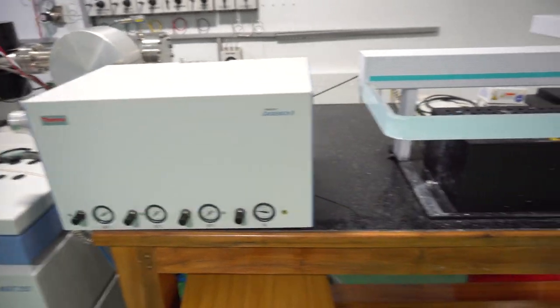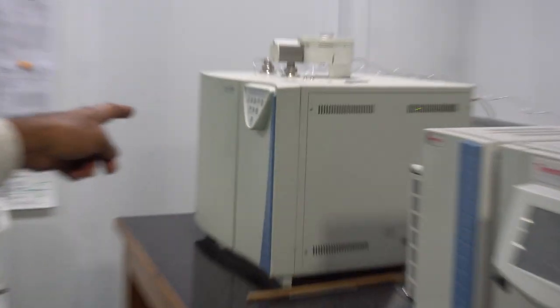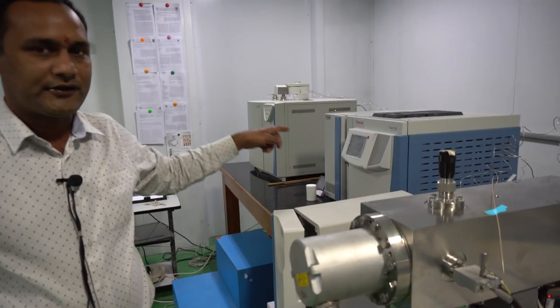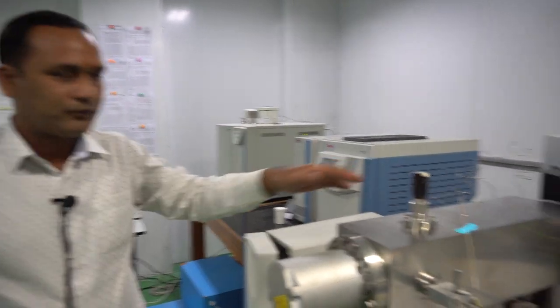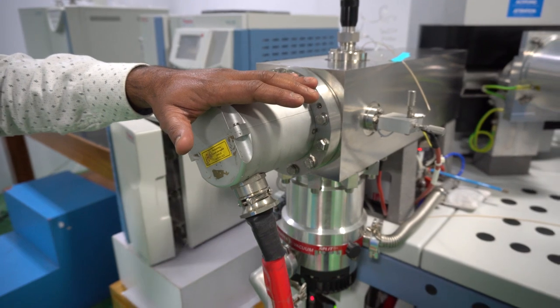This mass spectrometer is a gas source mass spectrometer, but from the field we collect solid rock samples, sediment samples, or water samples. Those samples we cannot put directly into this instrument. For this purpose we have three peripheral parts: one is gas bench, second one is GC IsoLink, and third one is elemental analyzer. With the help of these three peripherals we produce the gases and then send those gases to this IRMS, which measures the isotopic ratios of the desired gases.